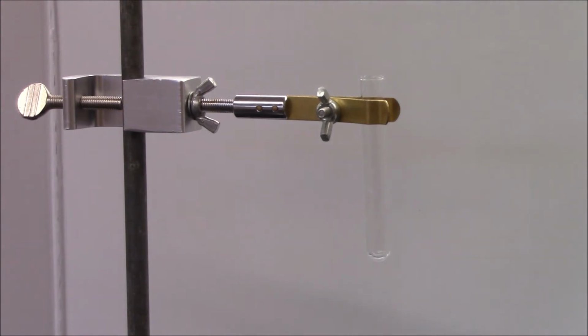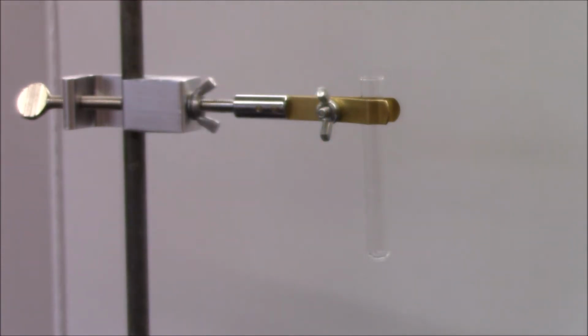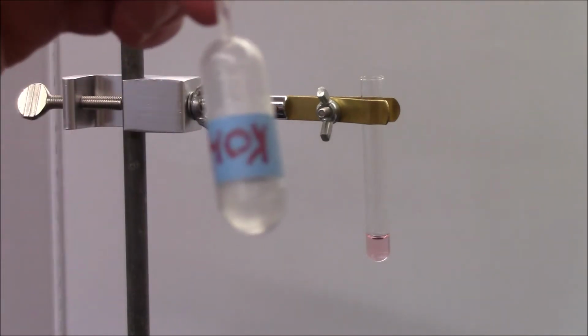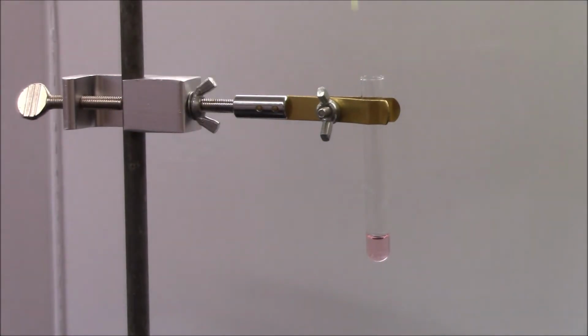Next, reaction number 2, we are going to be mixing cobalt(II) sulfate. If I have it here in front of the camera, you can see that it is pink and transparent. Pink and clear. I'll add some drops. You can visualize that in the test tube. To it, I'm going to be adding potassium hydroxide, KOH. If I bring that in front, you can see that it is clear, colorless and transparent. When I add it, my solution becomes cloudy. Remember, cloudy or a color change indicates that a solid has formed.